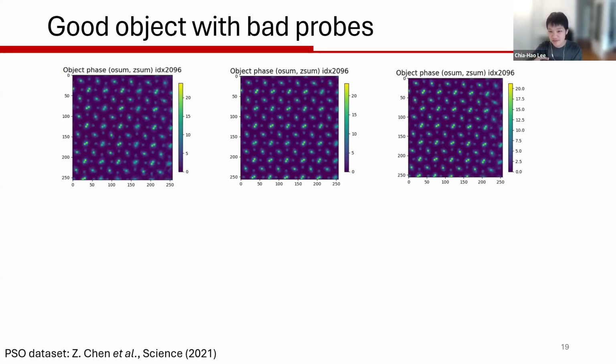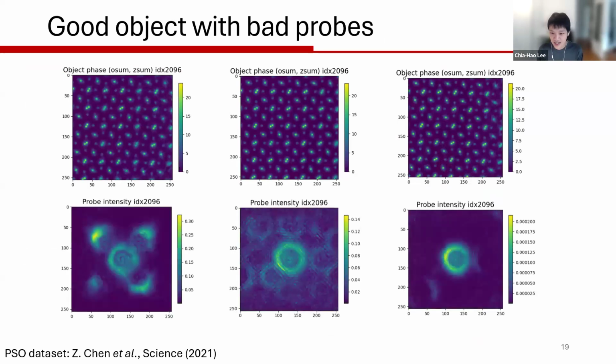Cool. So they all seem fine. But as the title said, these are good objects with bad probes. What I'm going to show you is I have to actually manipulate and mess up the reconstruction parameter quite a bit. If you mess up your aberration, if you mess up your reconstruction parameter quite a bit, you actually see all these weird probes.